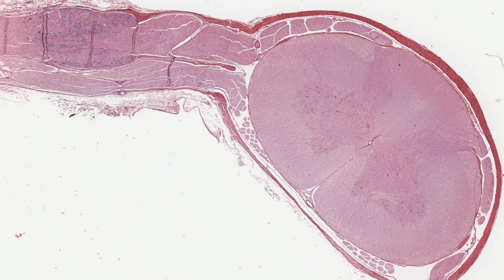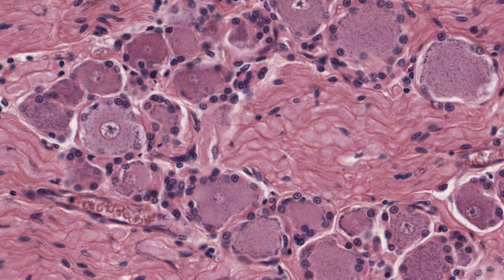I want to now examine this spinal or dorsal root ganglion. For each spinal nerve emerging from each vertebral segment, there is a single dorsal root ganglion such as this one sectioned here. A ganglion, or ganglia plural, is the structure outside the central nervous system that houses neuron cell bodies. These ganglia contain the cell bodies of sensory neurons.